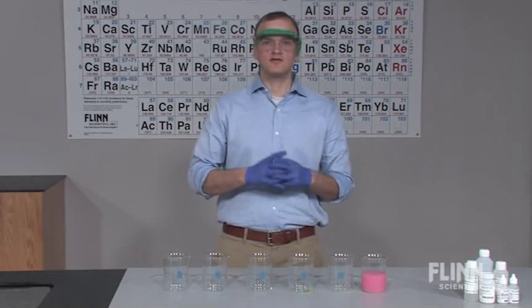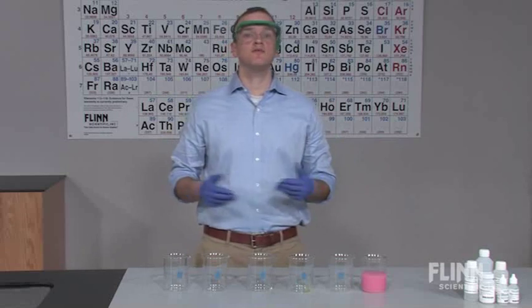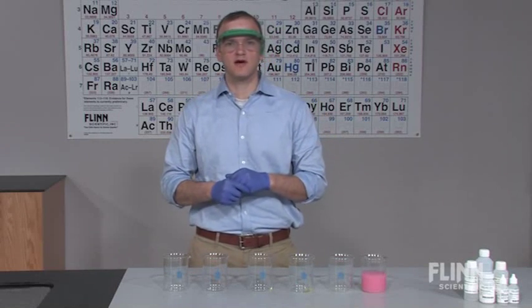This fascinating demonstration allows you to tell a creative story or just get to the chemistry of it by asking students to explain their observations.